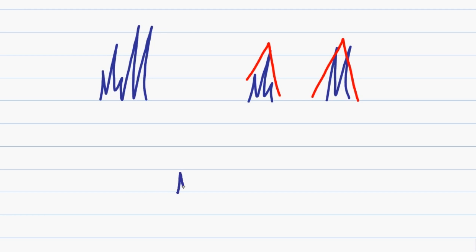And the hat trick has to do with a mathematical formula that tells you the height of the individual aspects of the peak. But instead of applying a mathematical formula when you are crunched for time, draw a simple hat on the peak. Notice that when I draw a triangle over this peak, I wind up hitting every single tip. Same thing for a doublet. And the same thing applies for this complicated quintet.